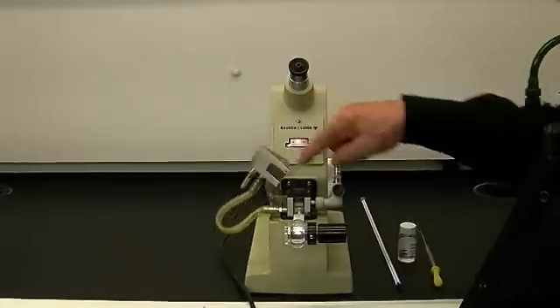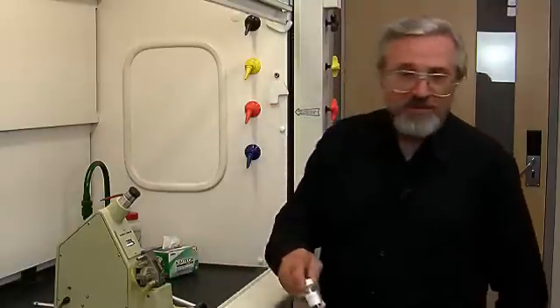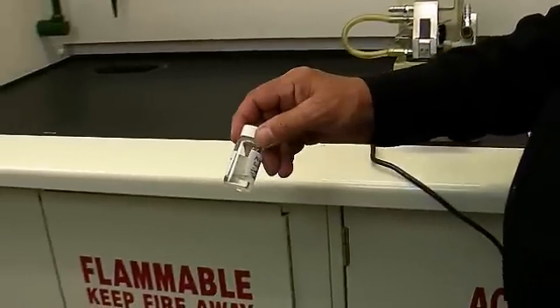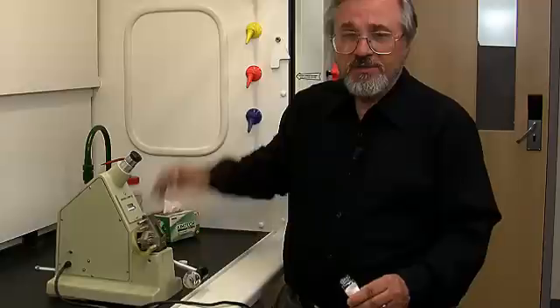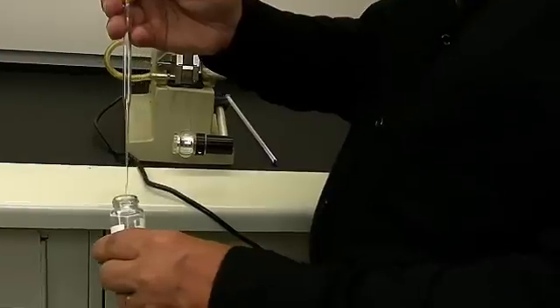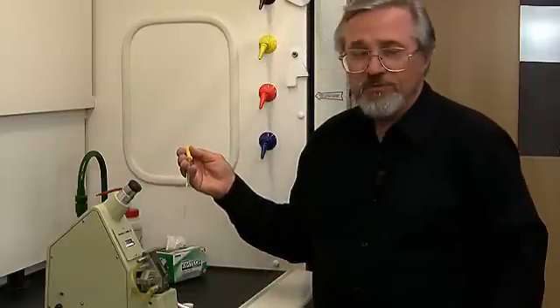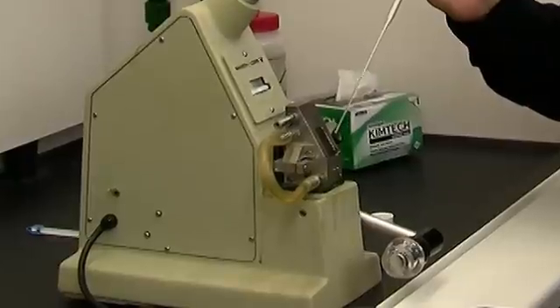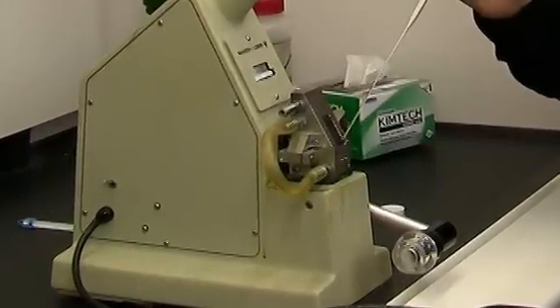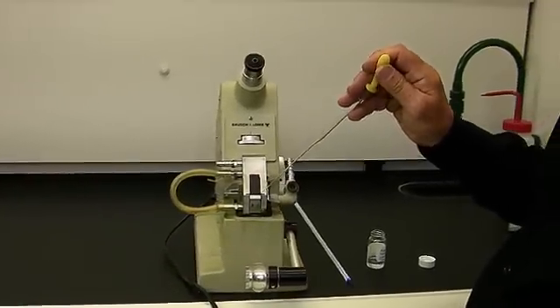The way we do this is to put the prisms together and put the little hatch door up. We're going to be using methyl benzoate, which is a clear colorless liquid. We're going to introduce the liquid under the prism faces using a few drops of the material in a pipette. You'll notice that at the right corner where the prisms are joined there's a little chip taken out of the glass, and that's where we're going to put our pipette to introduce the sample into the refractometer.